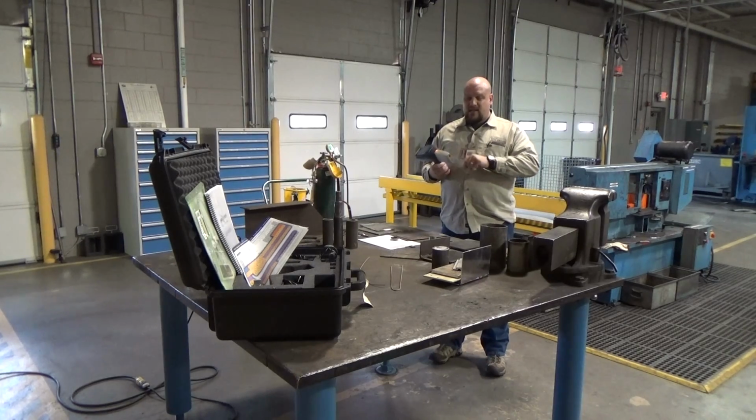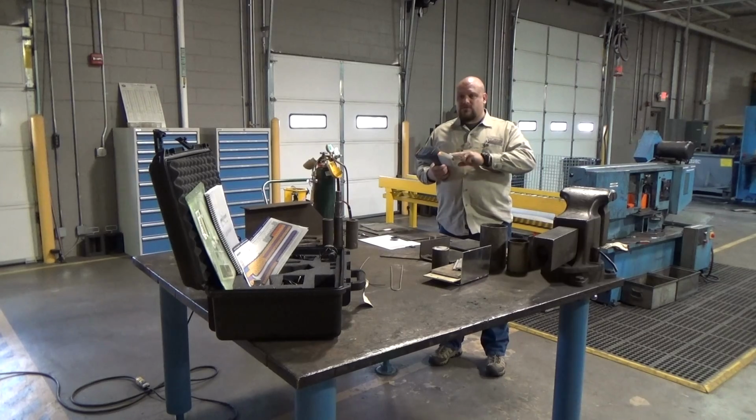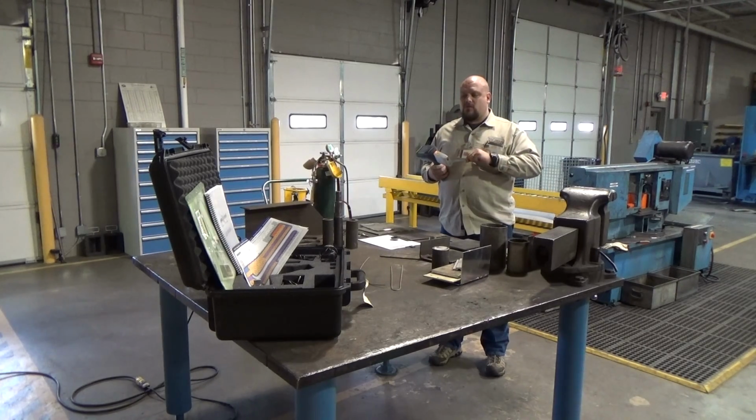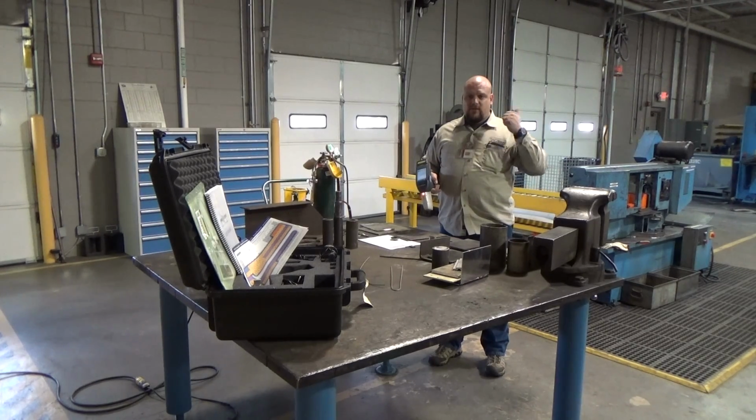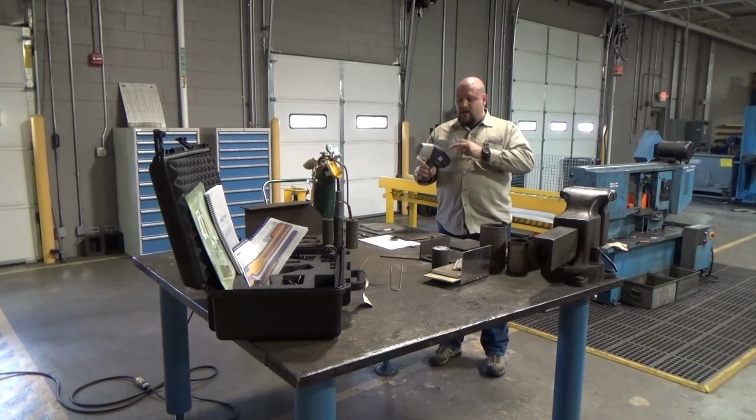And it's got a setting where if you're only looking for 304, you can set it up in there as a go, no-go. So as you take a sample, it's going to give you a positive or a negative and just tell you how it compares specifically to 304. So depending, there are many different ways that this can be used. A very expensive tool, but a very nice tool.